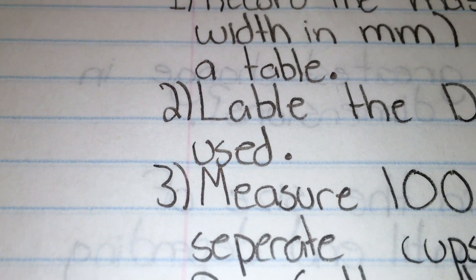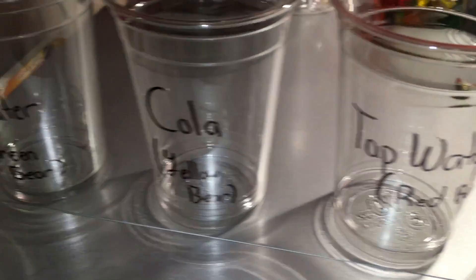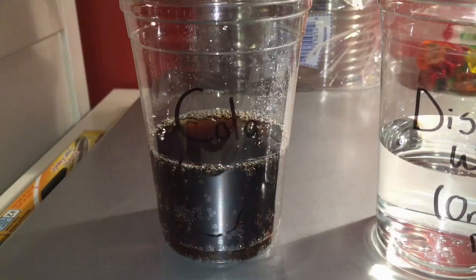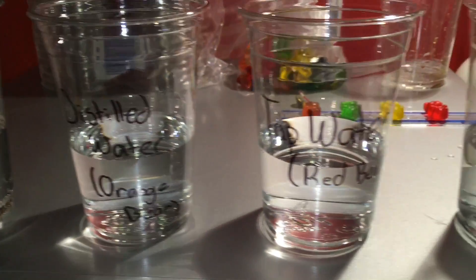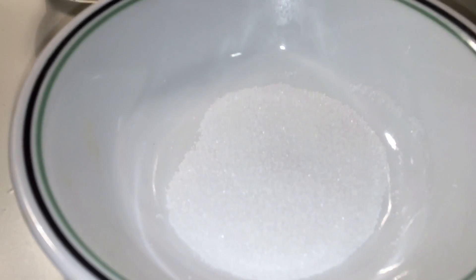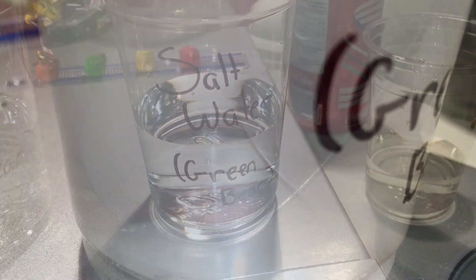For our next step we will need to label the Dixie Cups. The next step is to measure 100 grams of each solution. Then we measure 5 grams of salt, which will go into this cup. The salt has now gone in. Now all we have to do is thoroughly dilute the salt inside the water.